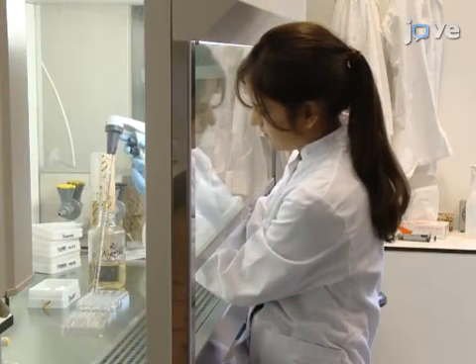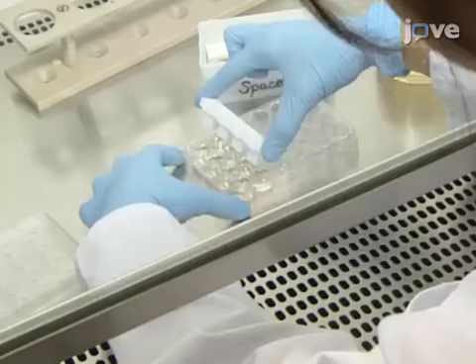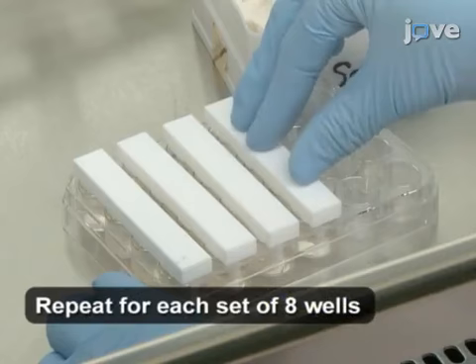Before beginning the procedure, add 1.6 milliliters of warm 2% agarose into the first eight wells of a 24-well plate, and immediately place polytetrafluoroethylene spacers into the agarose.